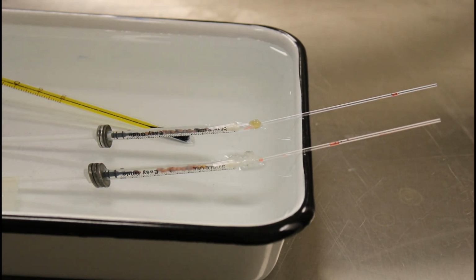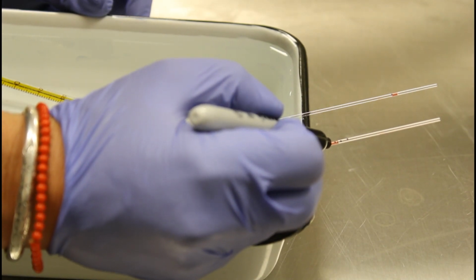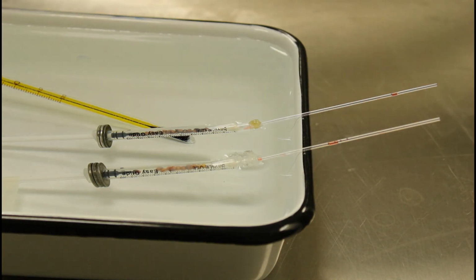Okay, so it's been almost exactly 15 minutes since we put the manometer fluid in the capillary tubes. The temperature of the water bath is holding steady at 26 degrees Celsius. As you can see, the manometer fluid is moving down still. So I'm going to put a mark at the bottom of the manometer fluid for our respirometer containing the living seeds. There's still been no movement in our control, so we're just going to keep that one black dot. There's no reason to do any other marks on that one. So we will check in on this again in 5 minutes, and then we'll record the movement of the manometer fluid. That'll be after 20 minutes total.